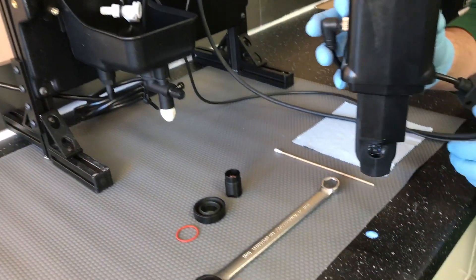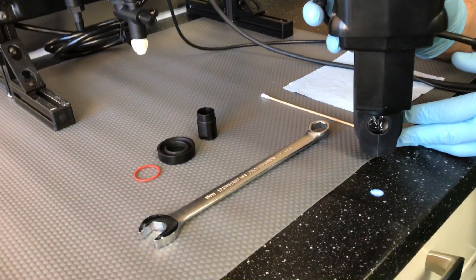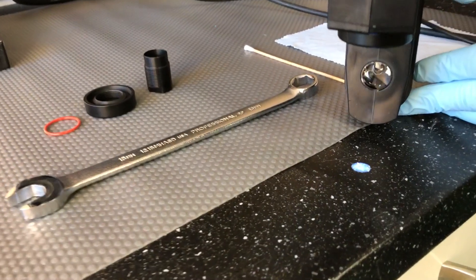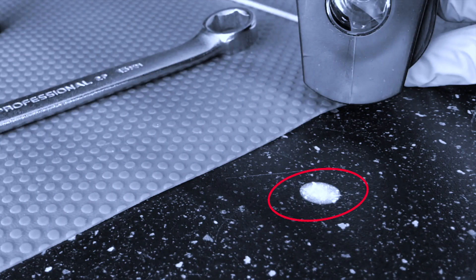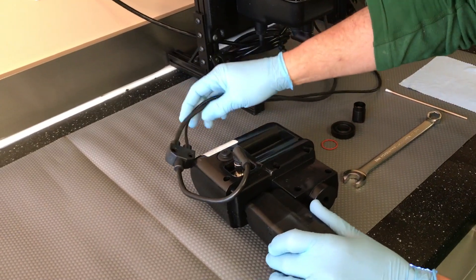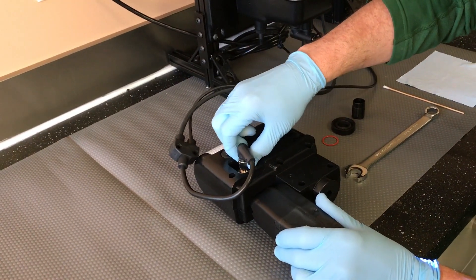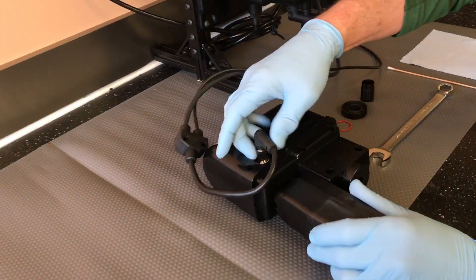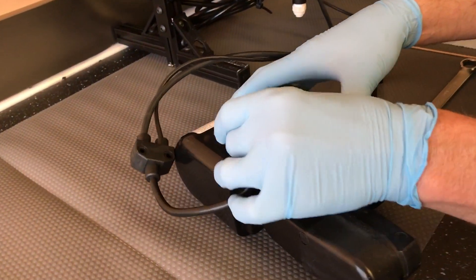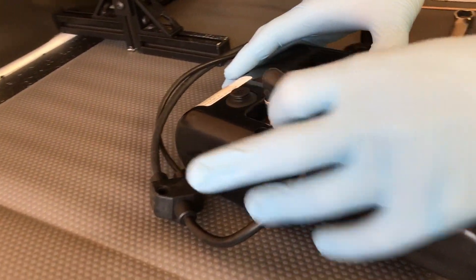Shine the beam onto a flat surface and note any irregularities in the shape and intensity of the beam. Place the measurement module onto a flat surface. A table or cart needs to be available.